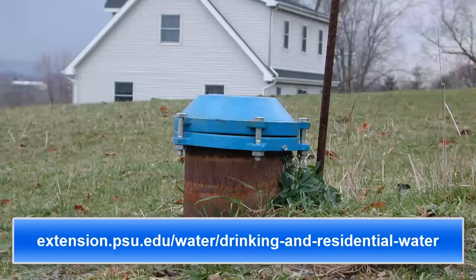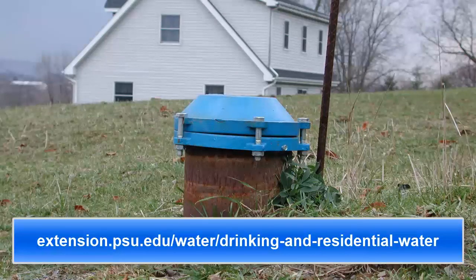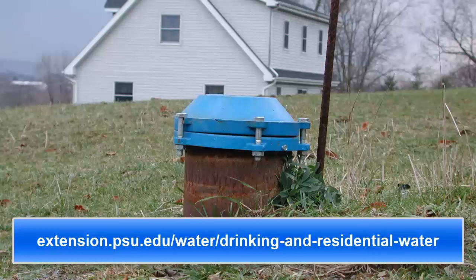If you need more help understanding your drinking water test report, contact the Water Resources Educator listed at the bottom of the report, or visit the Penn State Extension Drinking Water website shown here. This website also includes many fact sheets that provide tips on how various water quality problems can be treated or removed from drinking water.